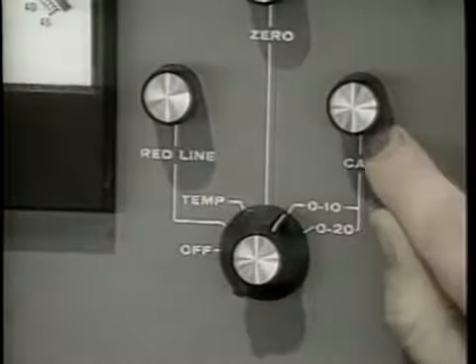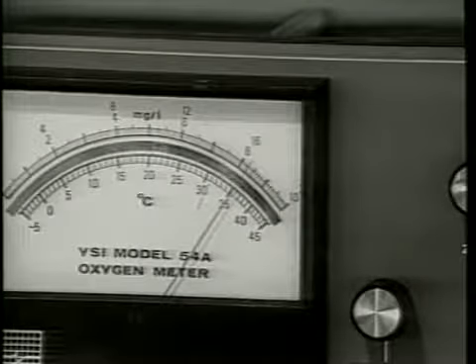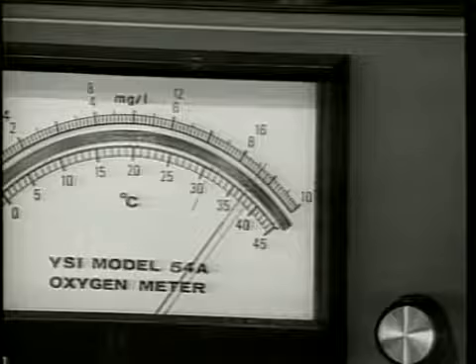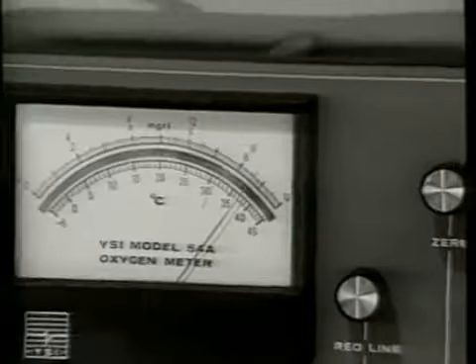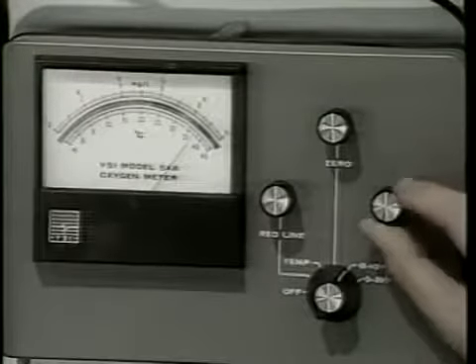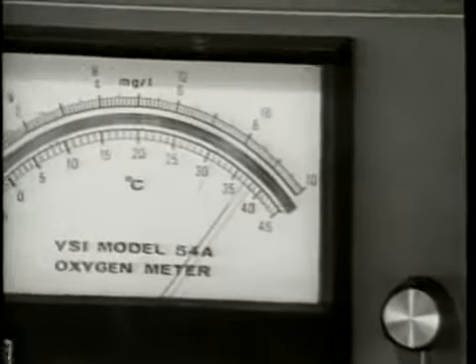Switch the meter to the 0 to 10 or 0 to 20 milligram per liter range and adjust the meter with the calibration knob until the derived calibration value is obtained on the appropriate scale. For example, to enter a calibration value of 8.54 using the 0 to 20 milligram per liter range, the meter is switched to this position and then adjusted to 8.54 milligrams per liter. Be sure to allow time for the needle to drift and readjust if necessary. The meter is now ready to take a reading.